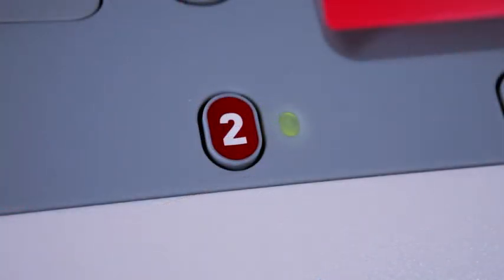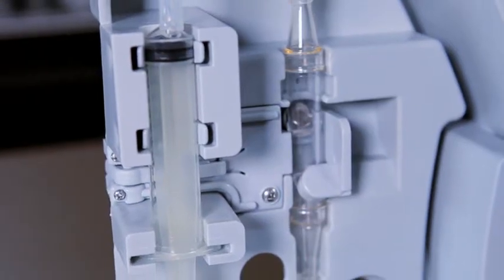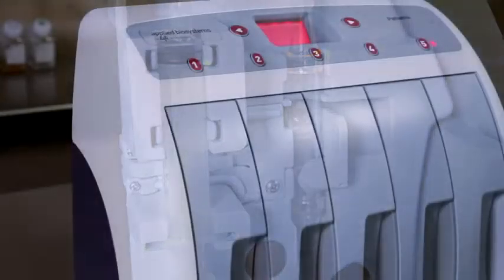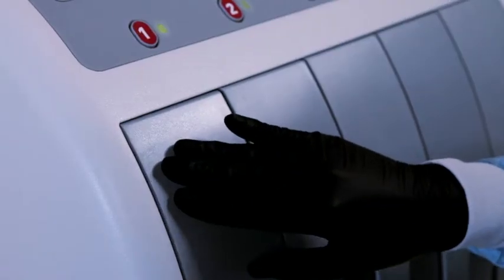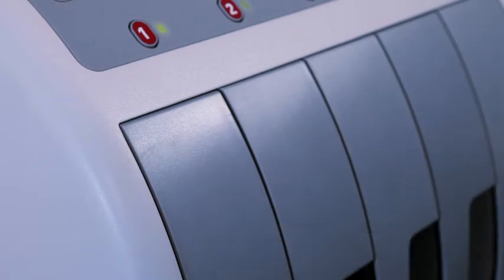If you hear a clicking sound around the time you would have expected the elution cycle to end and the light remains green, this could mean the magnet slider didn't release. Just push firmly on the front of the cartridge in the direction indicated. Listen for a click and continue with the normal steps.